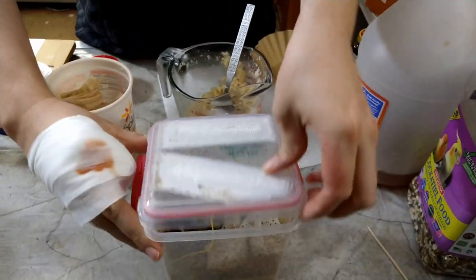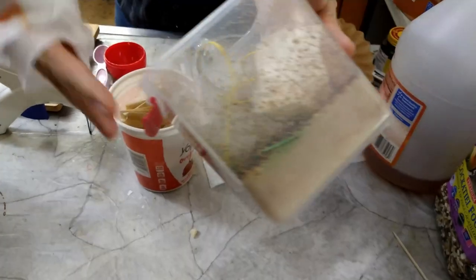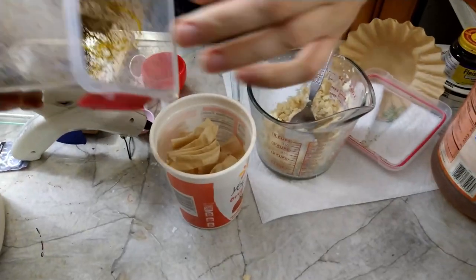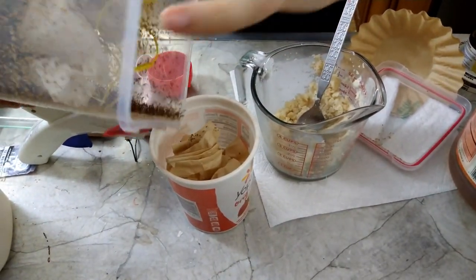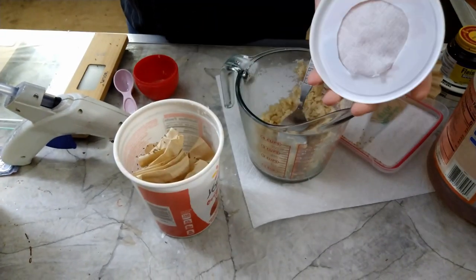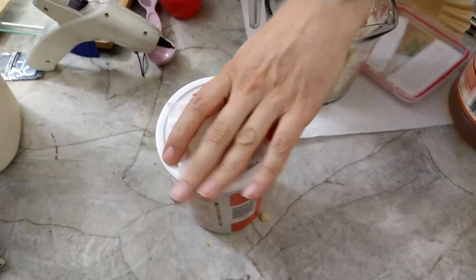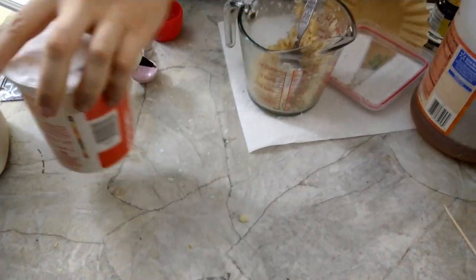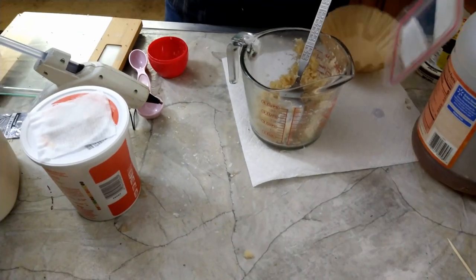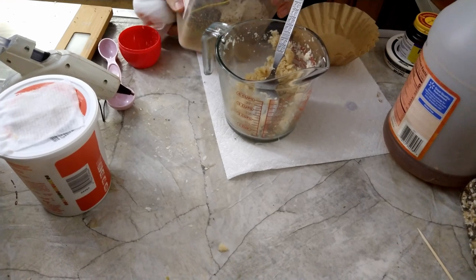Just tap them away from the lid and tap a few into the jar. You don't have to worry so much about them getting out because they're not going to turn into huge nuisances in your house — they're just gonna crawl around until they die.